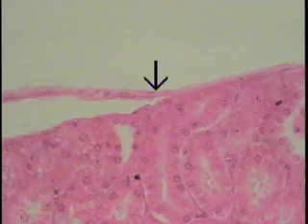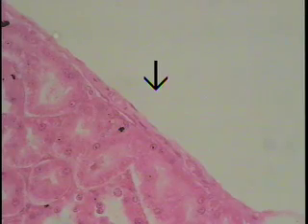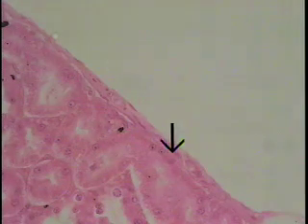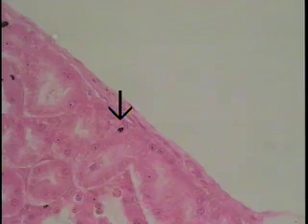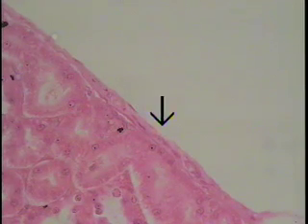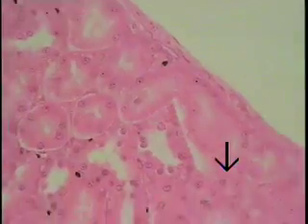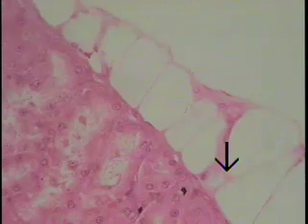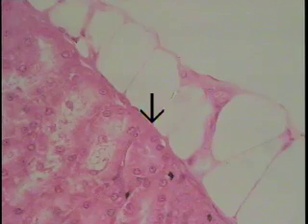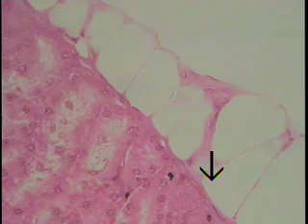I'll show you another region of it a little further along that's not quite as disrupted. This is another section demonstrating the renal capsule. The renal capsule extends from about the tip of the arrow to this point, so you can see it's quite thin at high magnification. As we course along, one can see the appearance of fat cells — part of the renal fat — and the capsule still adhering to the tubules lying just beneath it.